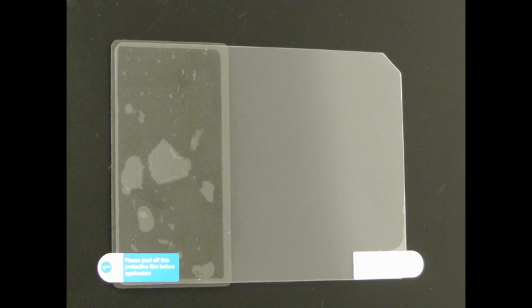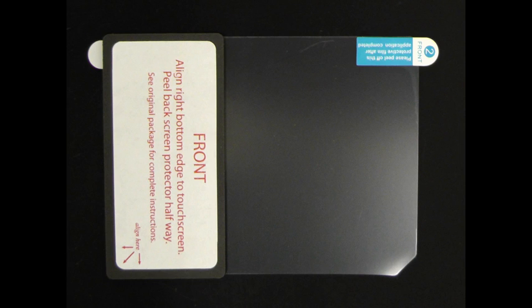Once the screen is cleaned, identify tab 1 and tab 2 of the screen protector prior to removing any protective layers.